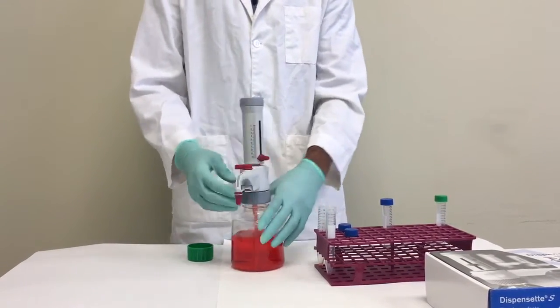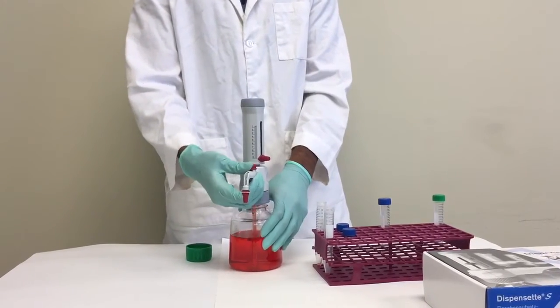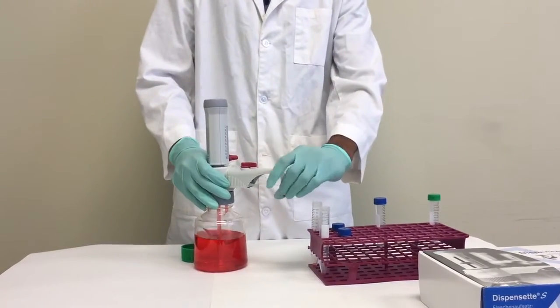When you are ready to start dispensing, switch the recirculation valve back forward and then unscrew the screw cap.